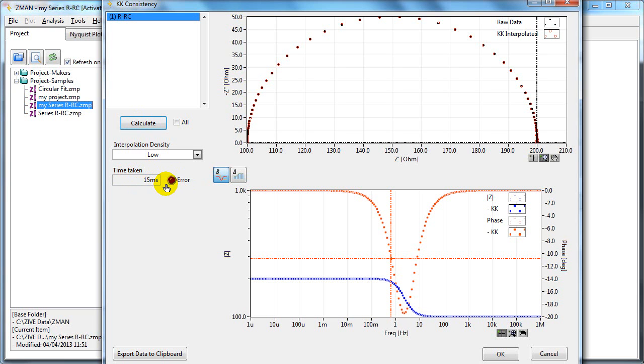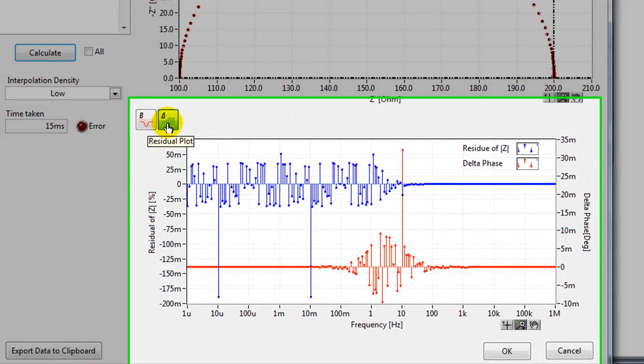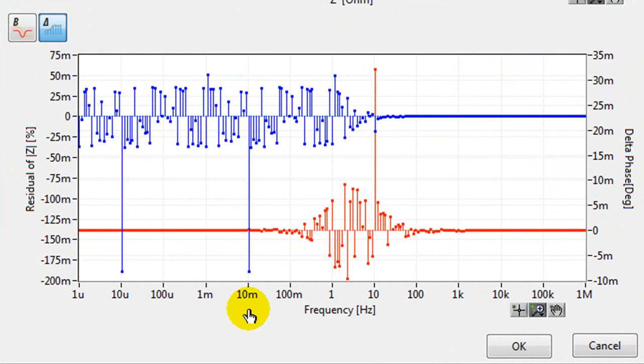In the Nyquist plot, the raw data are the black circles, whereas the KK data are the red circles. In the Bode plot, your raw data is the white circles, whereas the KK data is the blue and red circles. To check the validity of your data, you can look at the difference between your raw data and the KK data by looking at the residual plot. This shows the frequency on the x-axis and the residual data on the y-axis. Normally, lower peak-to-peak amplitude shows you've got better quality data.